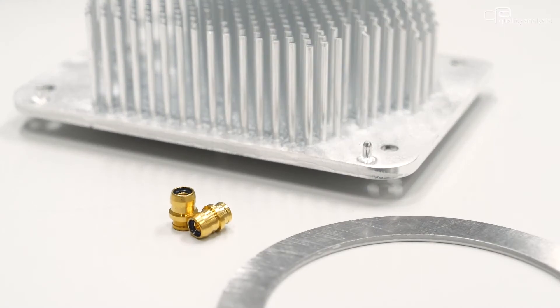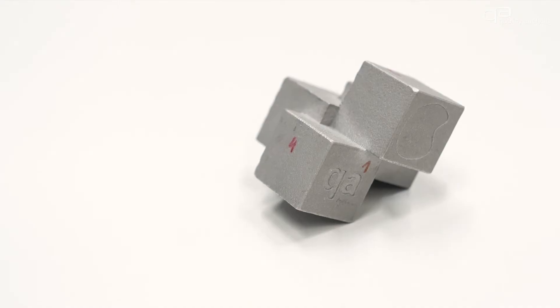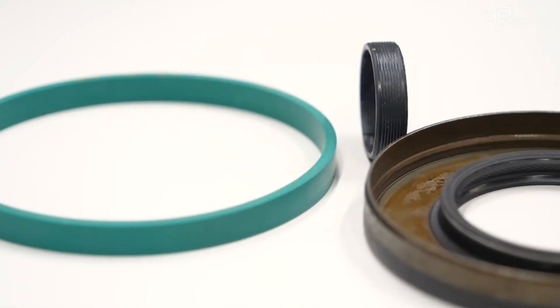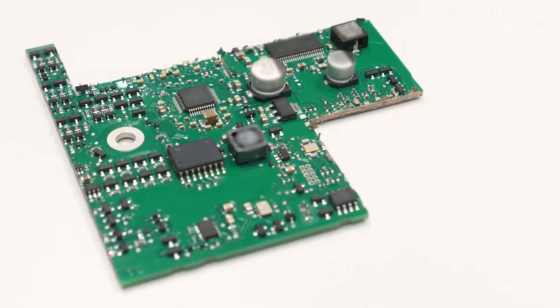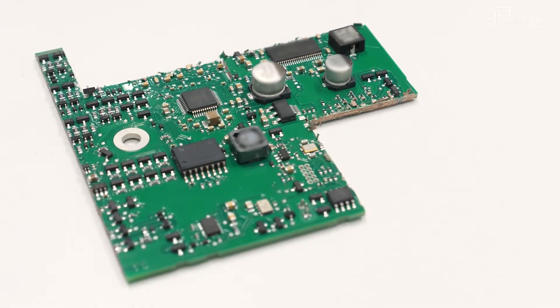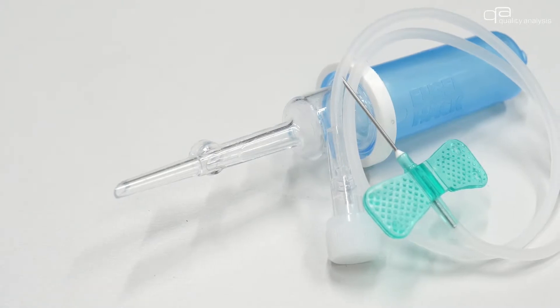Our experience covers a wide range of different components and materials, such as metallic components of all types and sizes, ceramics, magnetic components, additive manufactured components, polymers, printed circuit boards, silicon wafers from the semiconductor technology, as well as high precision components from the medical technology.